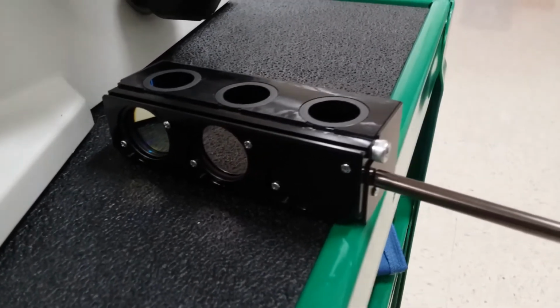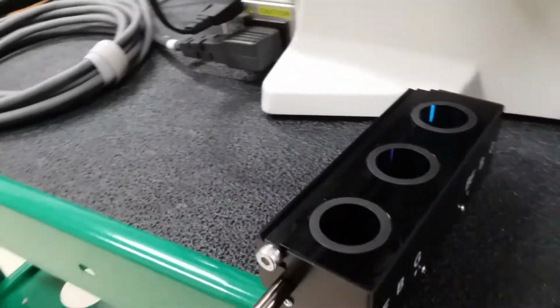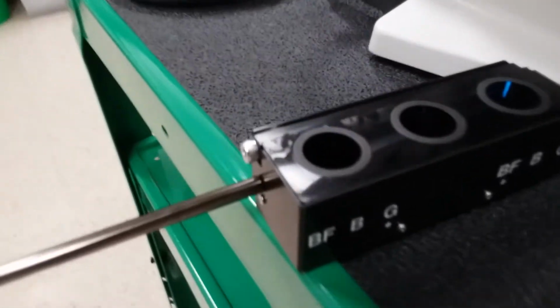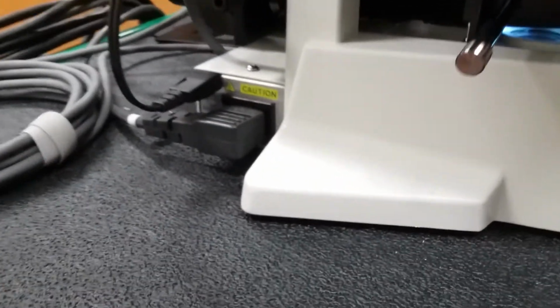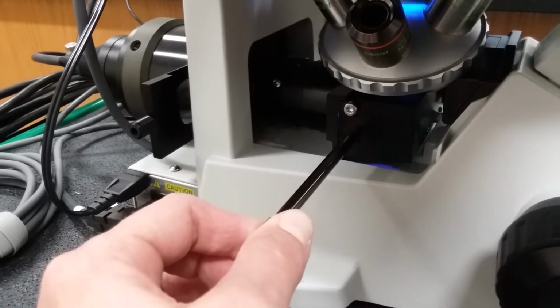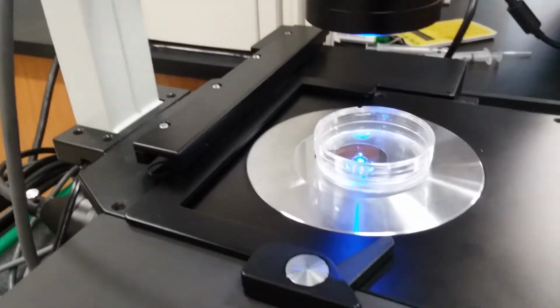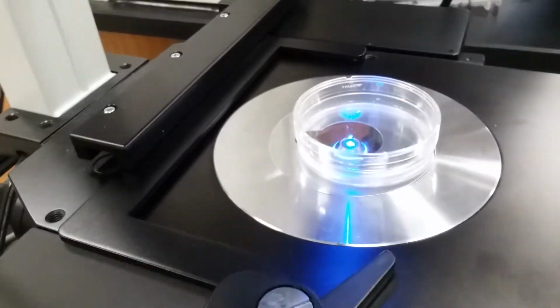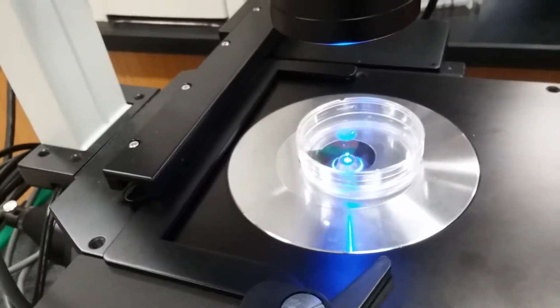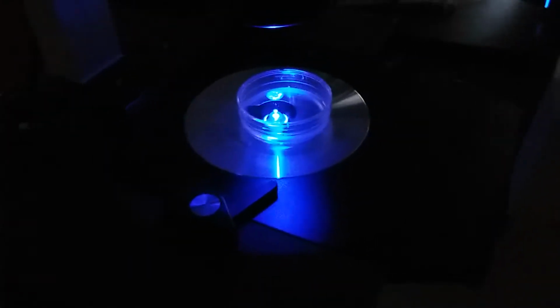We'll be going over this in a stylized way, but right now we want to pick the appropriate filter cube, which has a mirror that's going to move all the light. I have the appropriate filter cube established here, so I just pull out that stick. It could be a rotator. And the one important thing is I'm looking for green fluorescence, so I want to see blue. Okay, I turned out the overhead light. I want to see the blue.